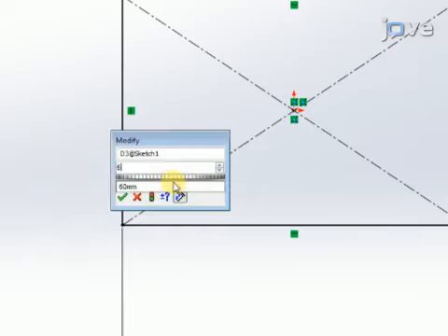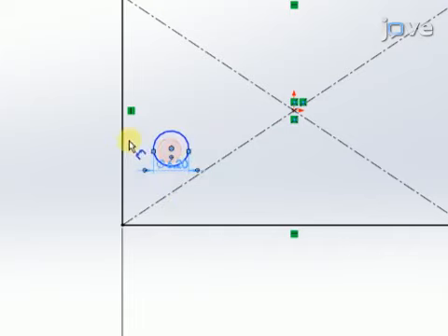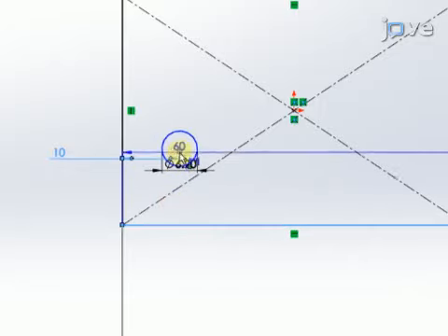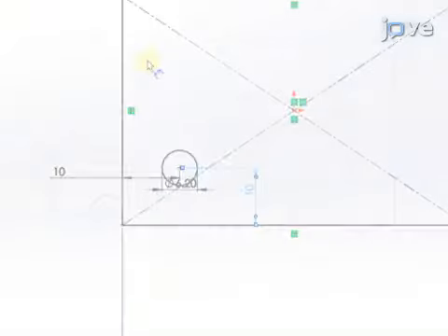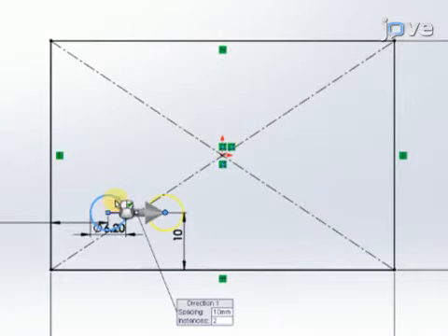At one corner of the rectangle, use the circle tool to create a 6.2 mm diameter circle. Center this circle 10 mm from the left edge and 10 mm from the bottom edge. Then, use the linear pattern tool to replicate the holes across the rectangle with 20 mm spacing for a total of 6 holes.